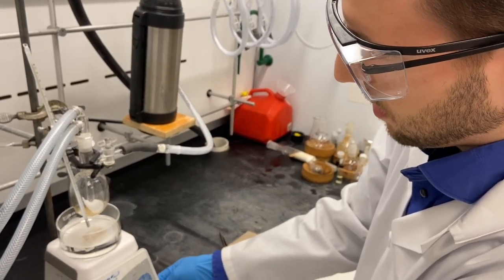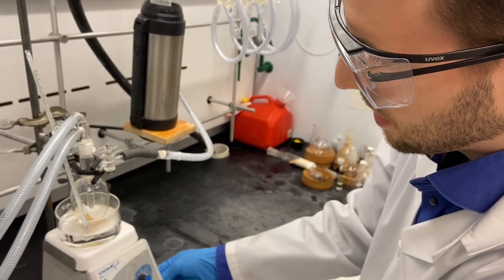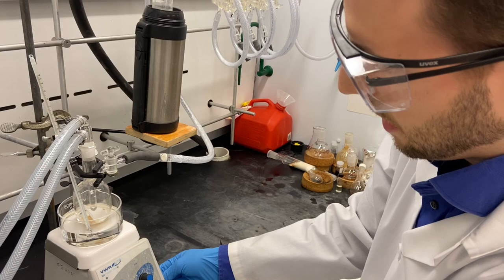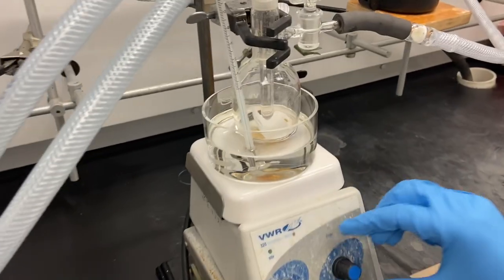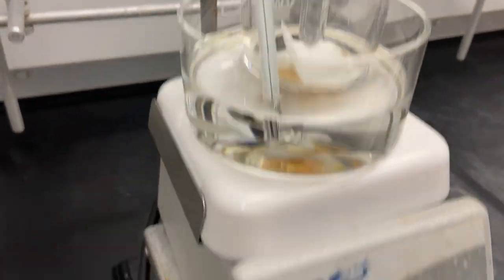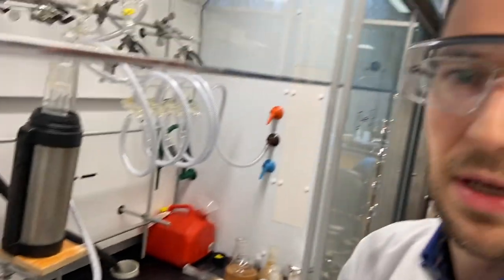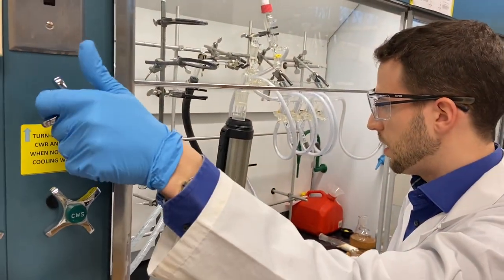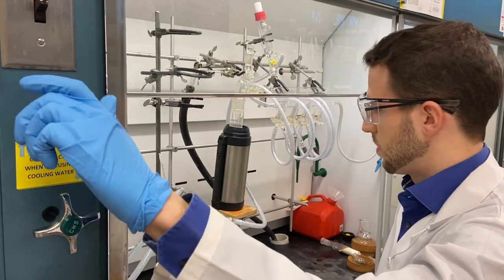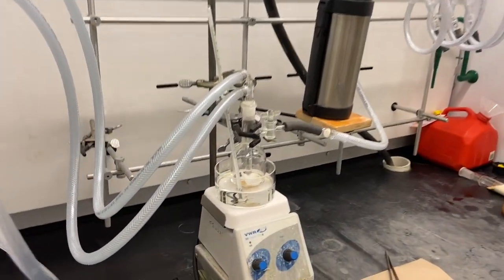So instead of estimating from a similar known compound to what temperature we have to go, we should gently heat up the whole system and wait for the first crystals to appear on the cooling finger. I'm turning on the water for the cooling here and monitoring the temperature.